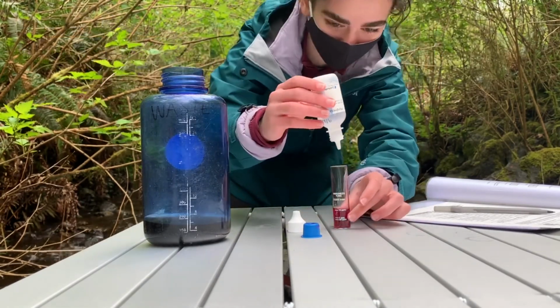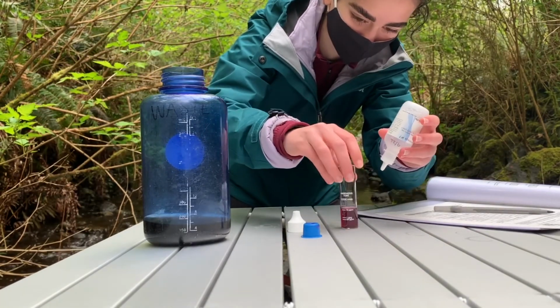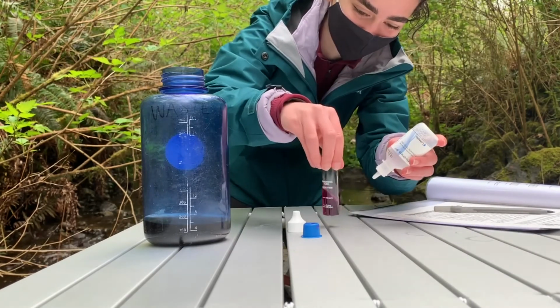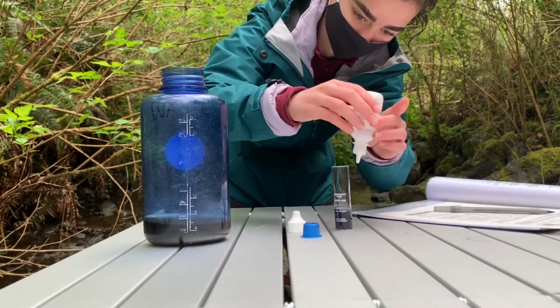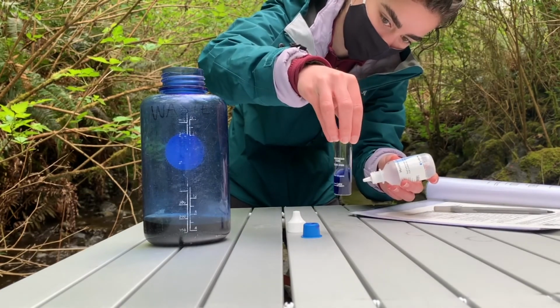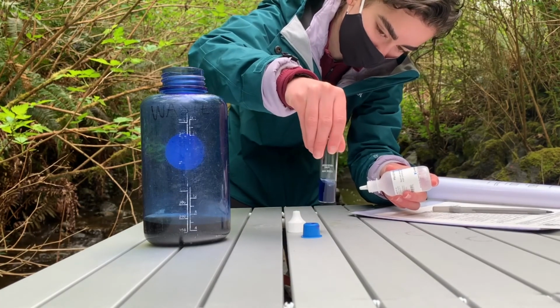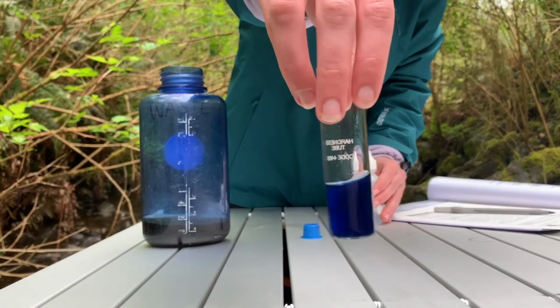Also, water hardness greater than 350 milligrams per liter can be harmful to humans and leave deposits in pipes and appliances. For example, limestone used on golf courses and agriculture can increase hardness. To measure water hardness, we perform a titration. We use a relatively small sample of water, and this titration can be slowed down in cold water, but it's fun to watch the solution change from pink to blue when the total hardness is reached.